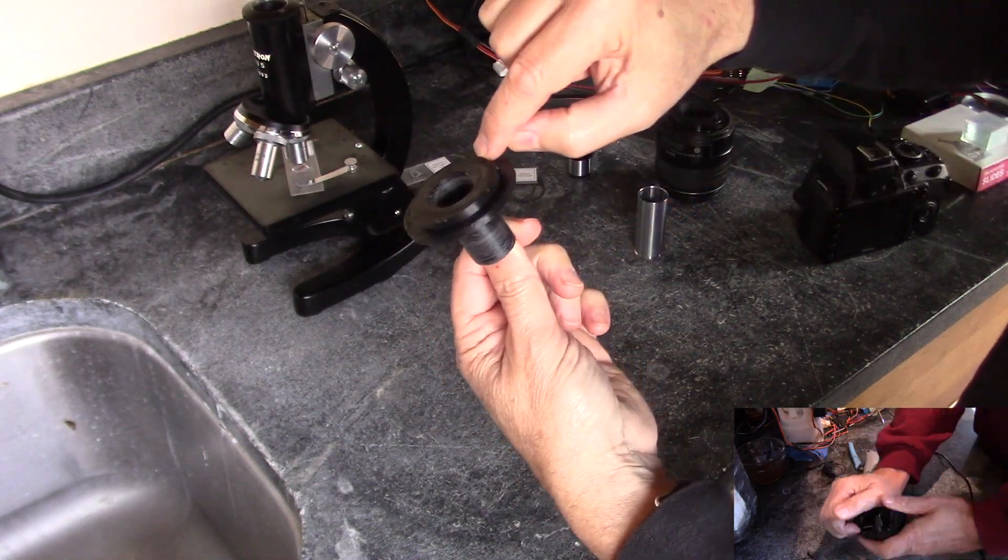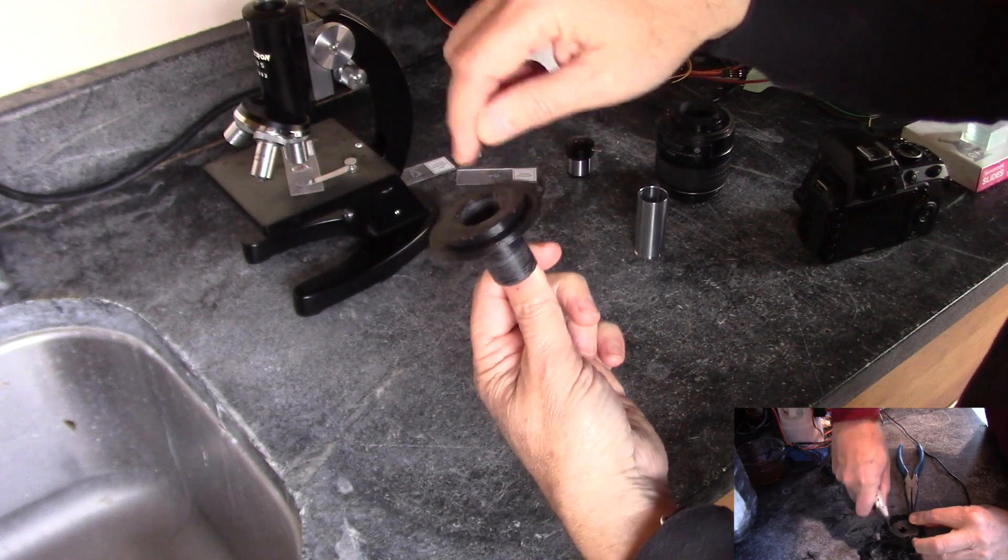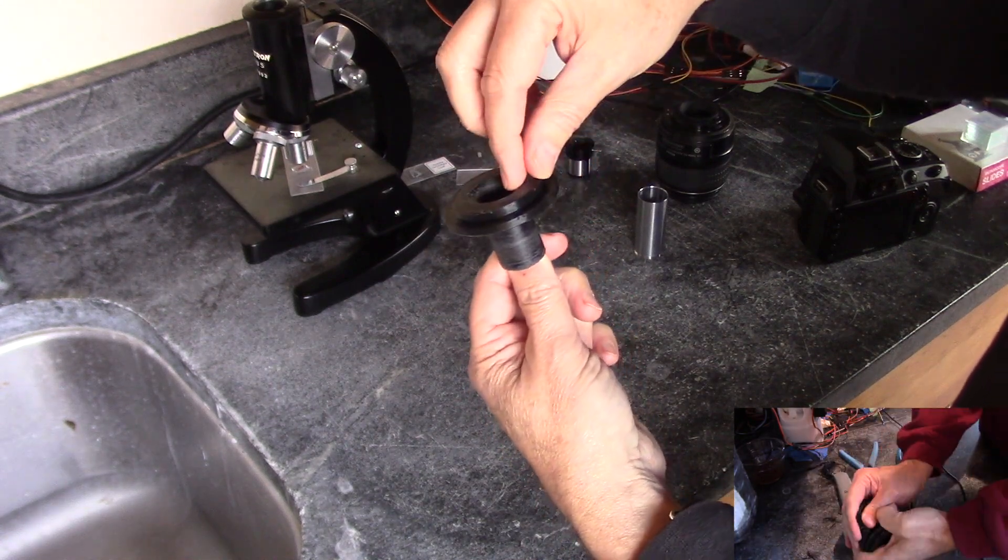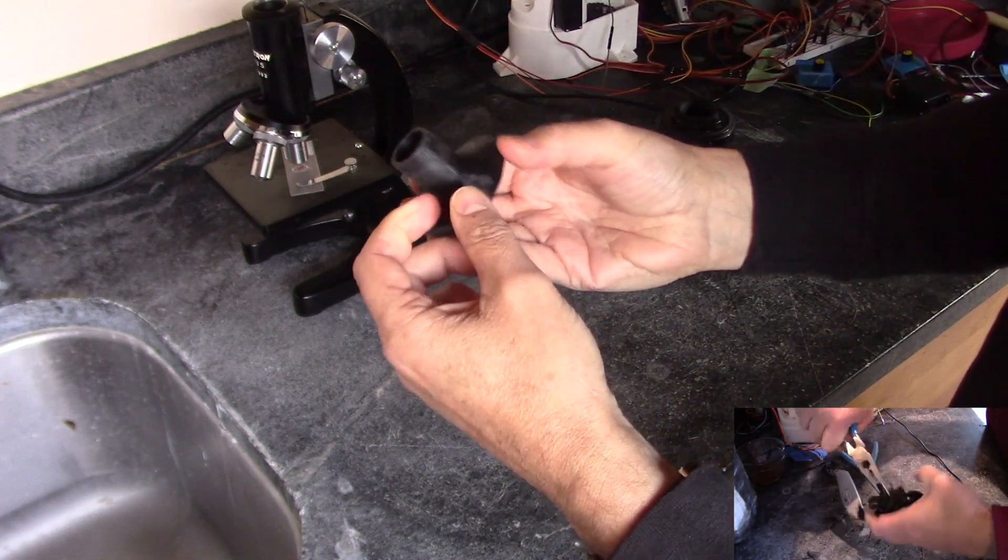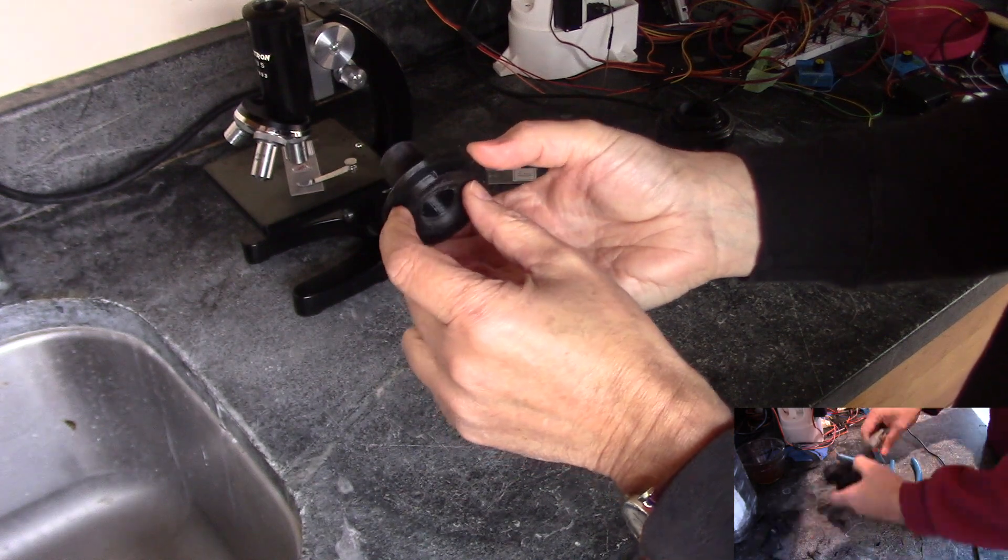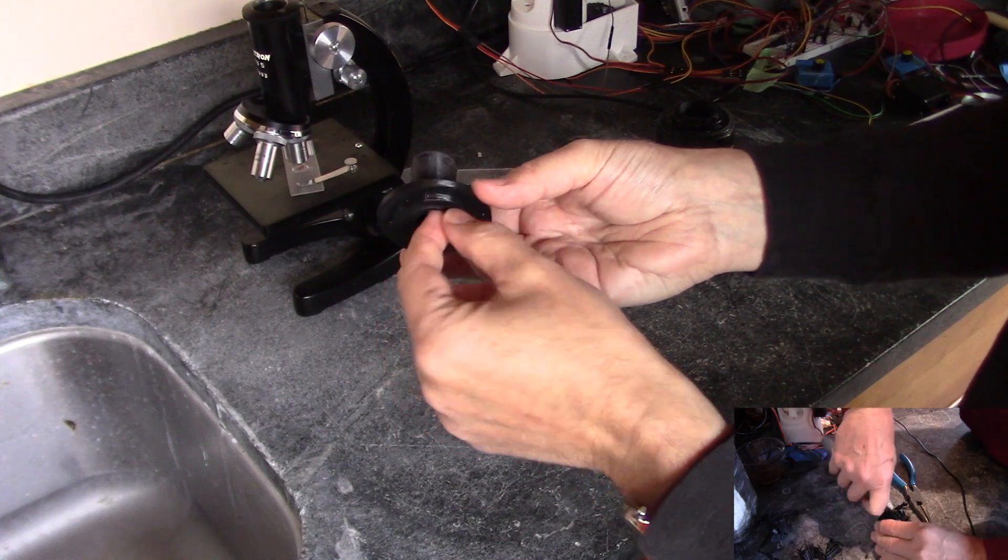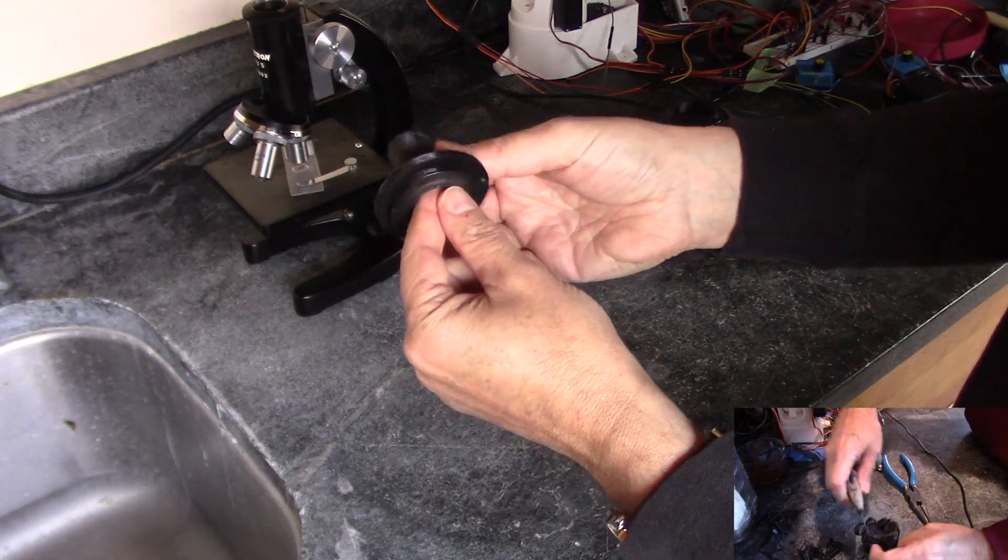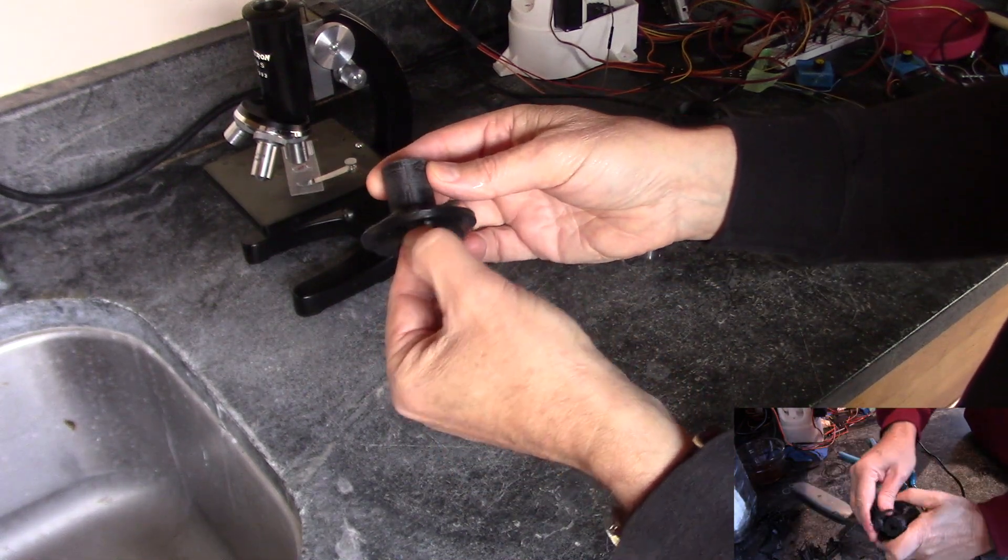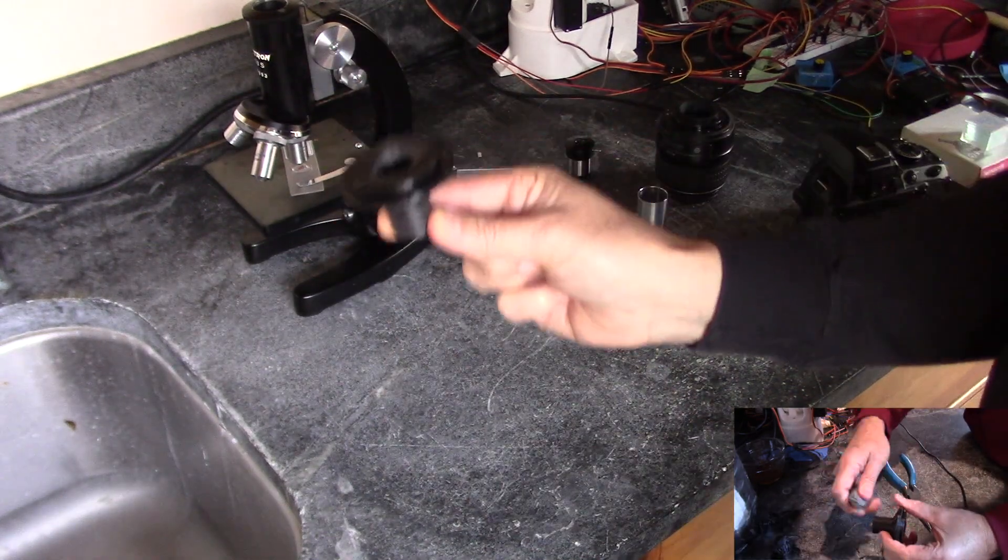Because you simply don't need anything past here and that would be a major pain to get any support material off of here. And if you did it like this, well then if you're willing to fight, you could do it that way, but that's going to be quite difficult to get them out of here. So I suggest you do it like this.